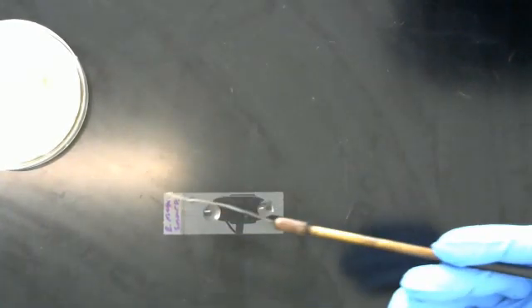And now, we have our cooled loop. I'm going to be doing this in my right hand because I'm right-handed. So here's where we're going to have our bacteria. Normally you would just take a single colony, but we don't have a single colony, this is a bacterial lawn. So we're going to take just a small loop full and put it right there.